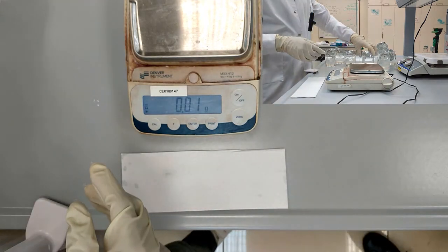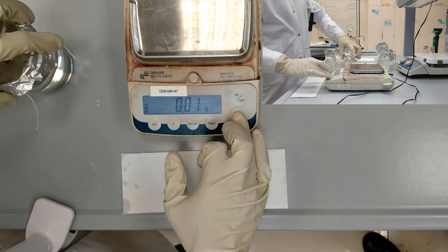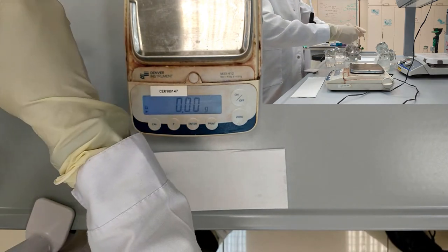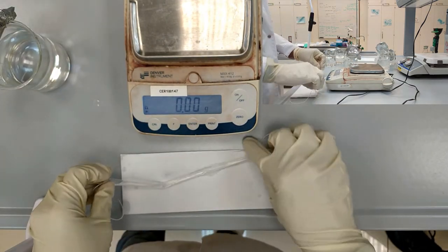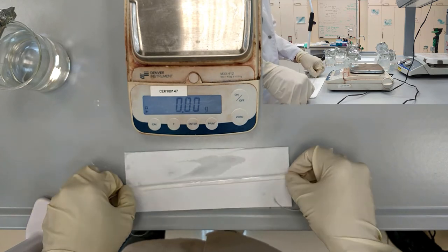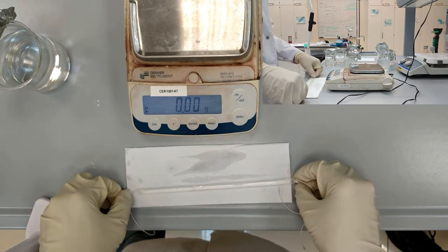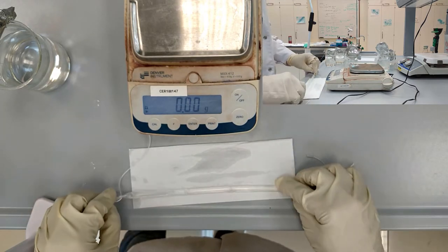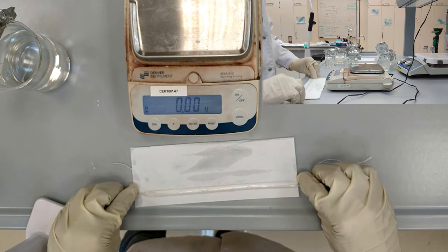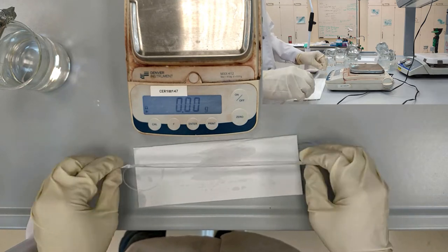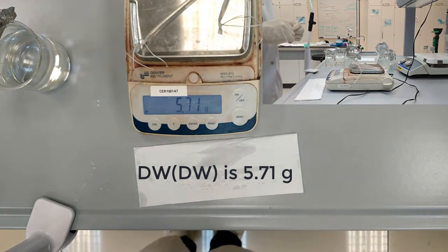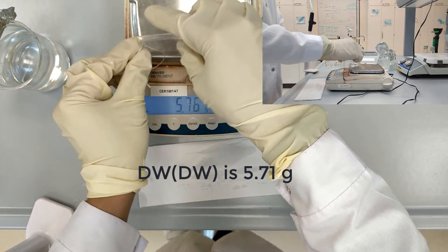Now we measure the distilled water in distilled water. As you can see, the mass did not change much. So it is 5.71 grams.